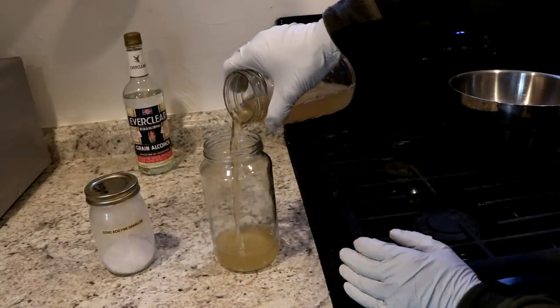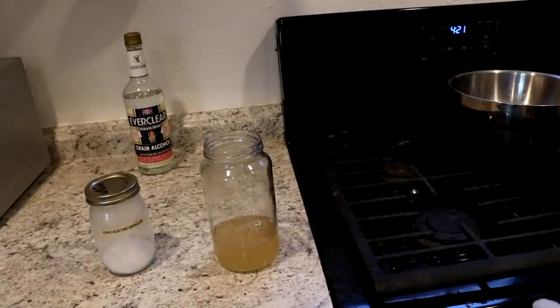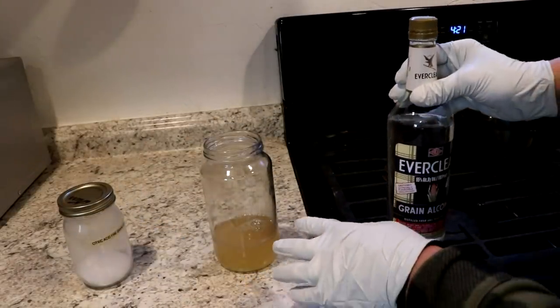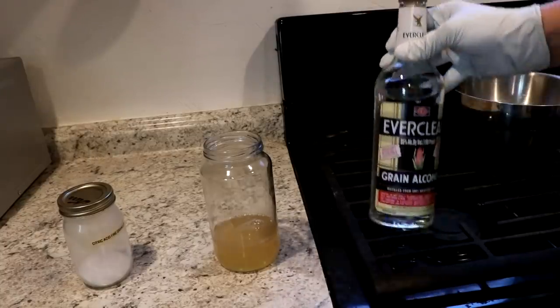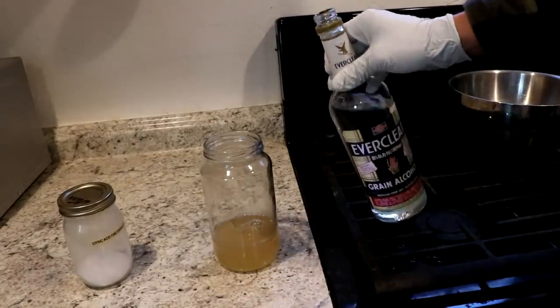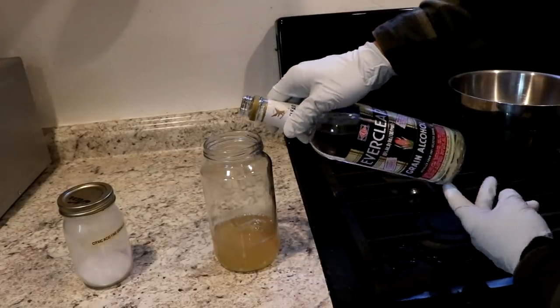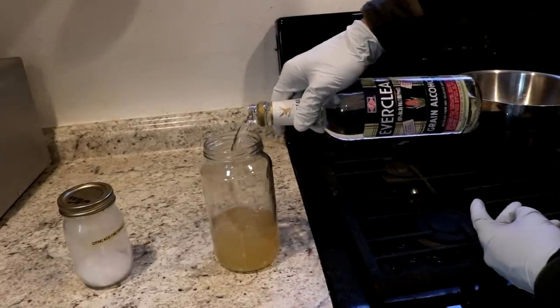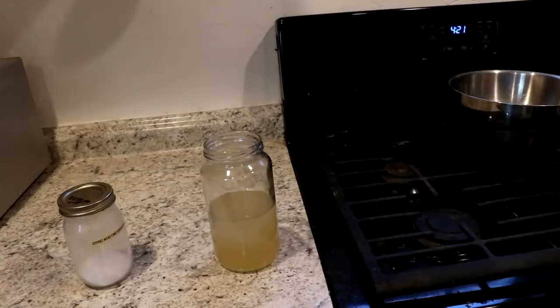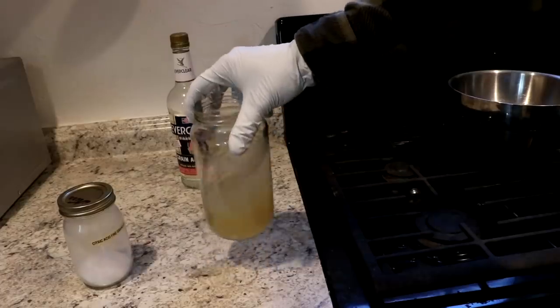This is probably really only something you'd want to do industrially, but let me pour off some so I've got some just in case I fail here. Pectin is a soluble fiber — soluble in water but not soluble in alcohol. It does have to be rather strong alcohol, otherwise you'll use a lot of it. You pour this in and the pectin should precipitate out as a gelatinous material — that's about double the volume. Let's see if that was enough.